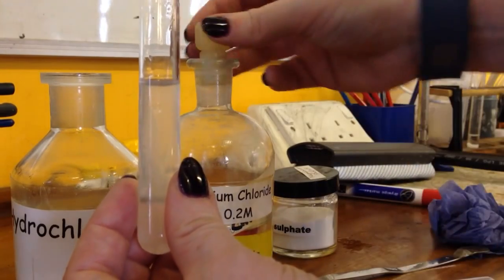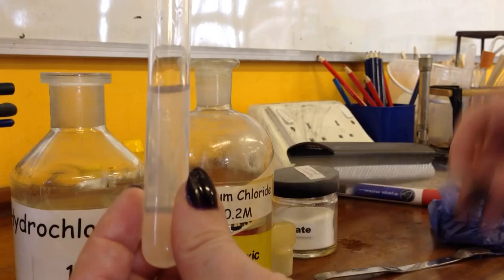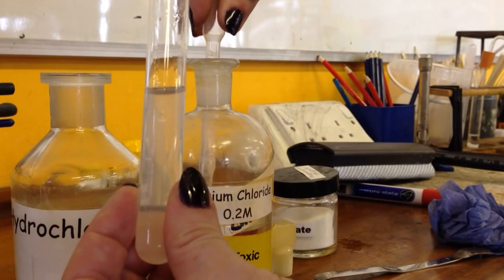Add in some hydrochloric acid there. You can see it's a touch cloudy but not very cloudy. It's kind of clear really.